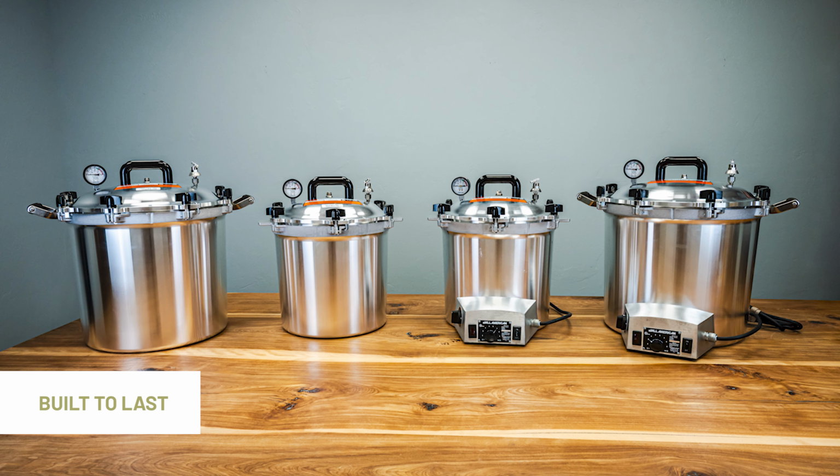First, we will talk about inspecting the metal-to-metal seal. You want to remove the lid and inspect for any damage on the seal surface of both the lid and the bottom of the unit. Imperfections on the sealing surface can happen over time with the use of the unit. If your unit has cracks or is unable to build or maintain pressure, please contact customer support.